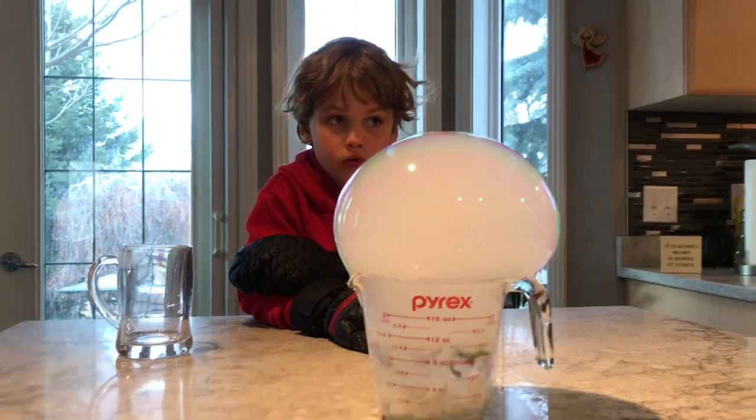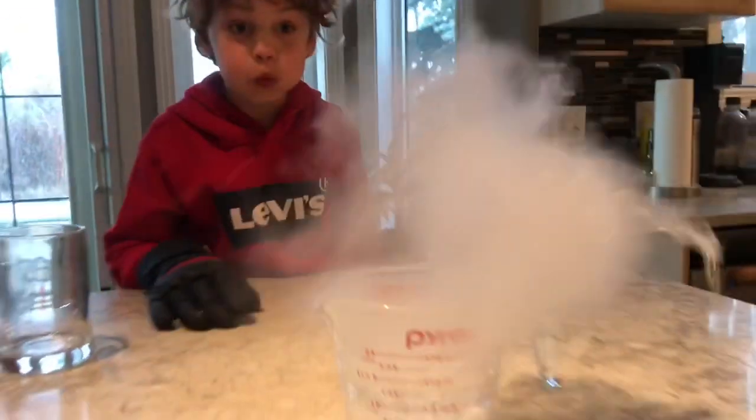Do you want to blow it? Yeah. Go. Today we learned how to create carbon dioxide gas using both physical and chemical changes. Right, Professor Marcus? Where's Professor Marcus?